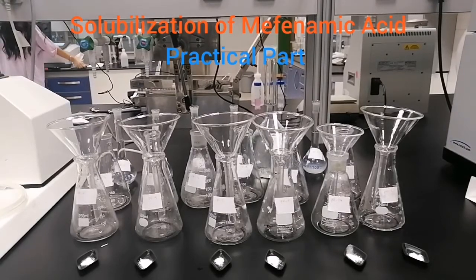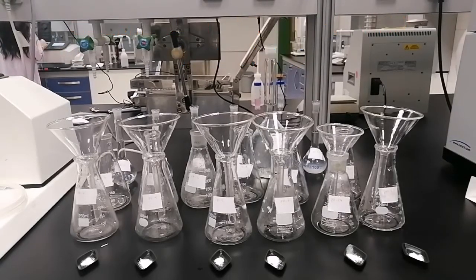As we explained before, a drug must be soluble before being absorbed in the media surrounding the receptors. Around 40% of drugs have solubility problems, so aqueous solubility is a key factor in designing different dosage forms. The solubility is defined as the maximum concentration or maximum quantity of the drug dissolved in a given volume of solvent at specific temperature. And here we work at 25 degrees Celsius.